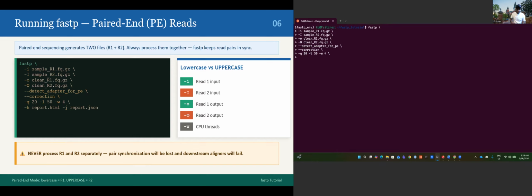And now let's generate the report, dash H for the HTML, let's call it report.html, and dash J, report.json. I think if I didn't mistype anything, it should work. If I did, I will go back and try to troubleshoot where I mistyped.